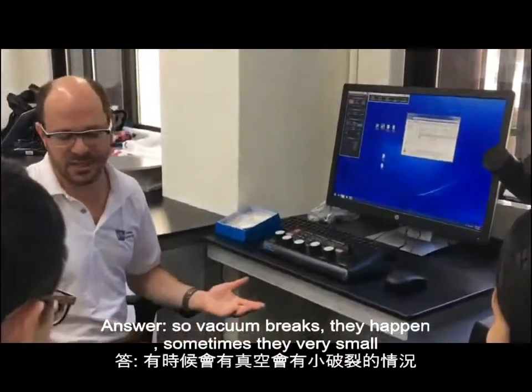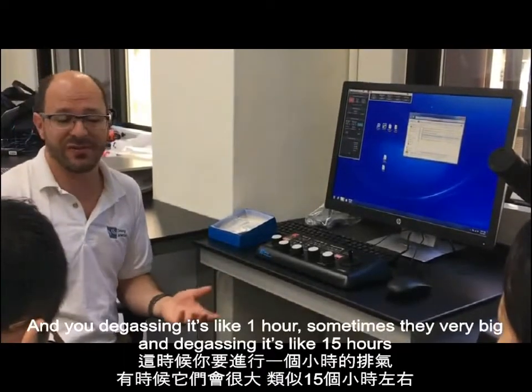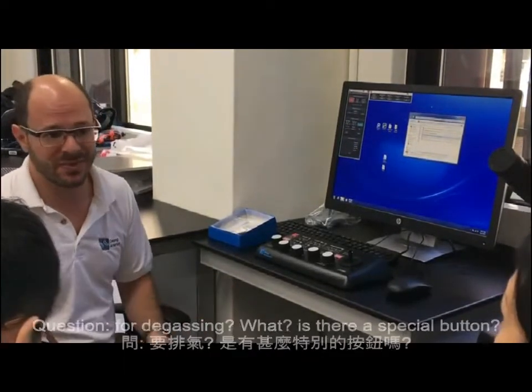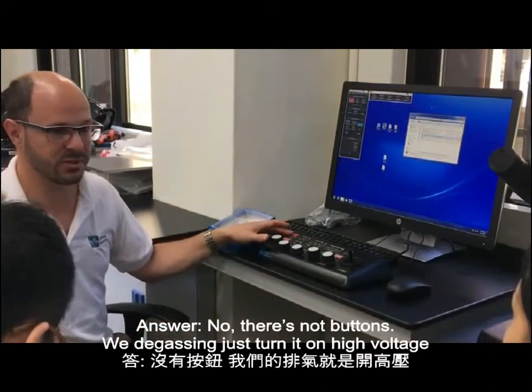Vacuum breaks, they happen. Sometimes they're very small, and the degassing is like 1 hour. Sometimes they're very big, and the degassing is like 15 hours. For the small thing, for the degassing, is there a special button? No, there's no button. We degas it just by turning on the high voltage.